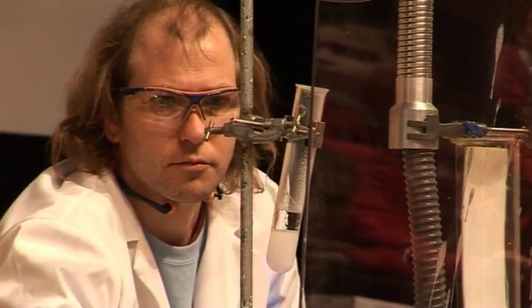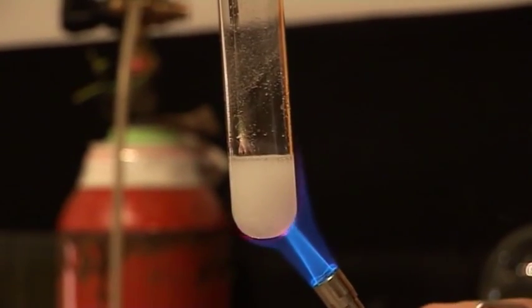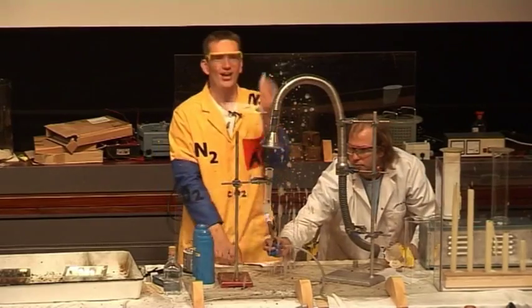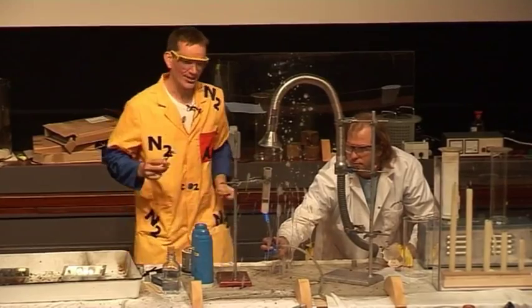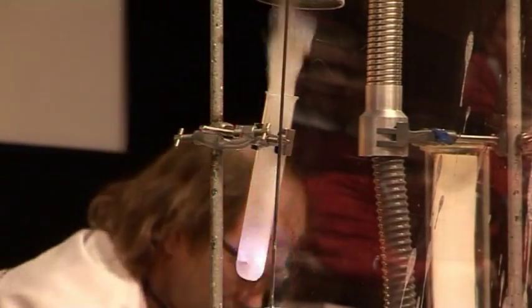Well, I can show another reaction with this. This time I'm going to react the oxygen in the potassium chlorate with another jelly baby. All right, so here goes.